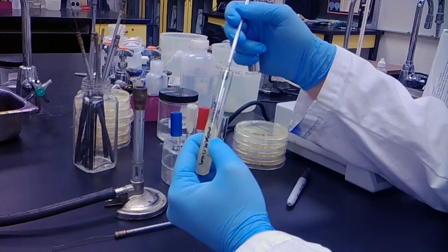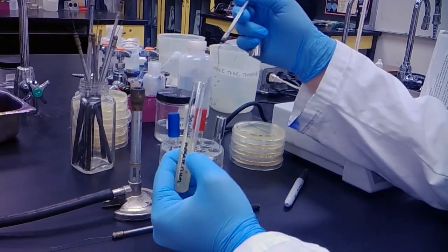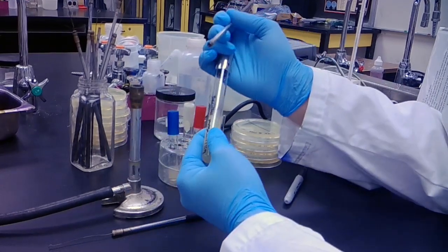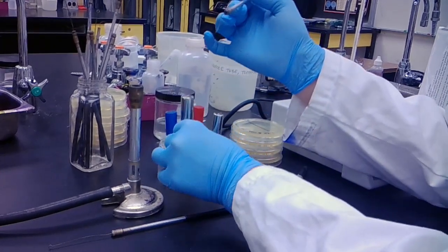I'm just going to take a small amount. Just by depressing this rod into the bacterial growth will be enough to collect the bacteria that I need.